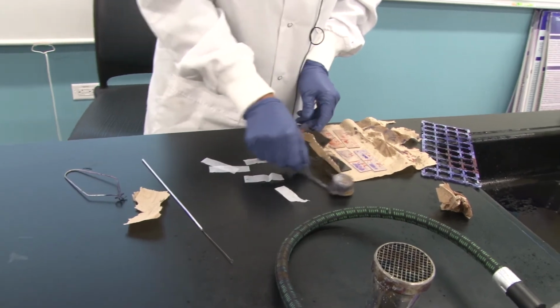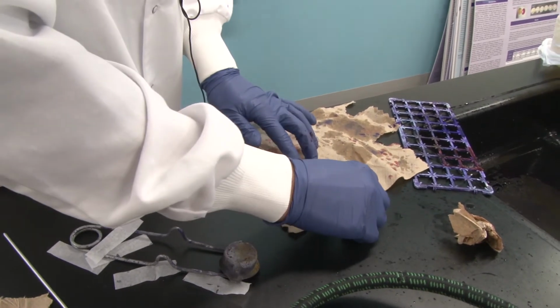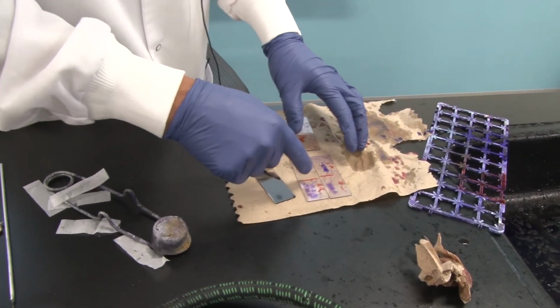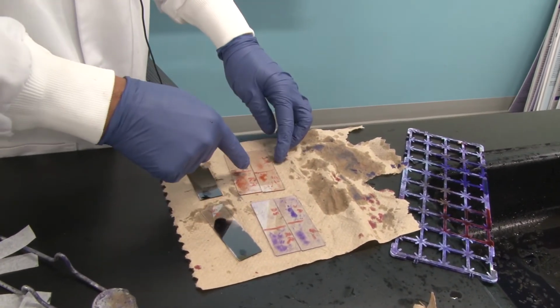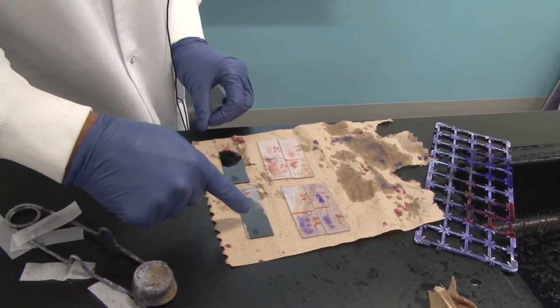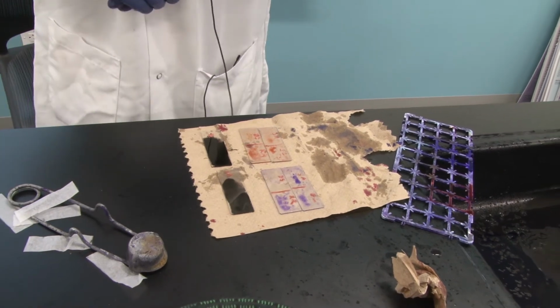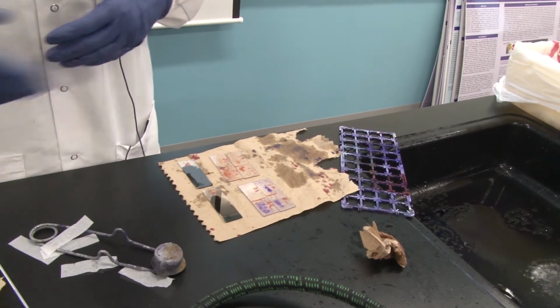So what I've got here are 6 slides, and this set right here is a set of simple, basic stains using crystal violet. This is a set of simple, basic stains using safranin. And this is a set of simple, negative stains using nigrosin. These are heat fixed, these are not. Okay. So I'm going to meet you at the instructor microscope and we'll have a look at these slides.